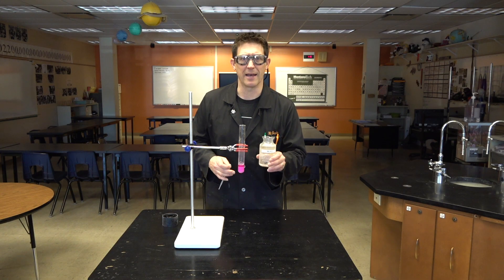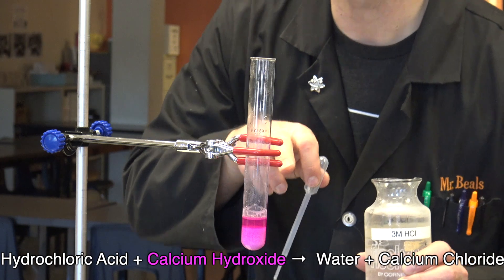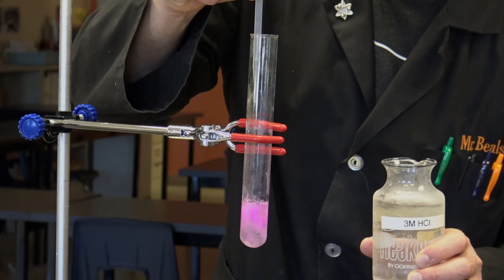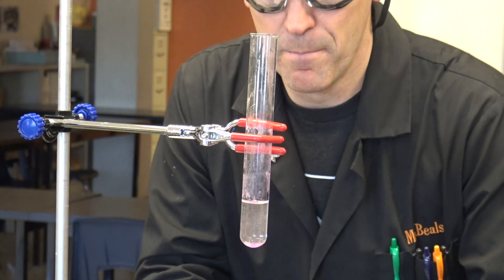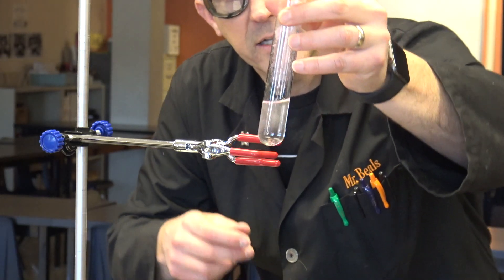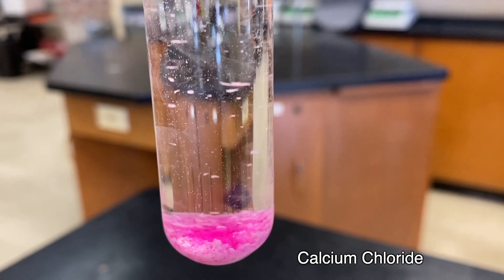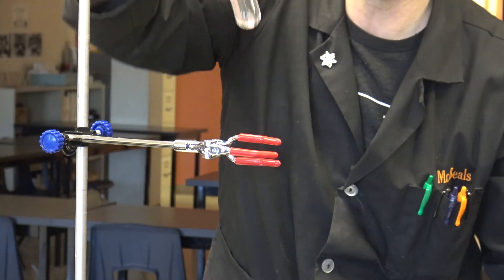I'm going to use some hydrochloric acid. So we're going to get a reaction now where the acid is going to react with the base — the calcium hydroxide in here. Whoa! The whole thing we just made is gone, except for some little, tiny pink snow crystals in the bottom. We've made our little snow globe here by a whole series of reactions.